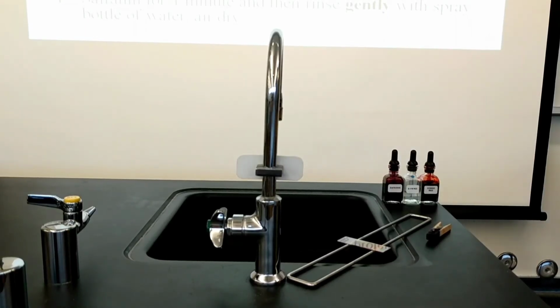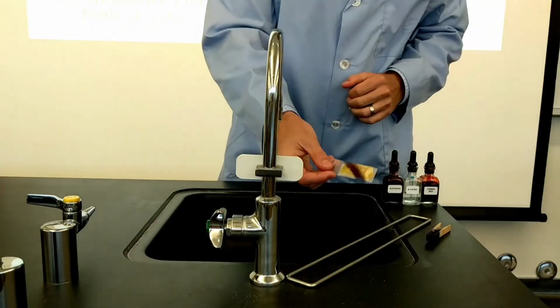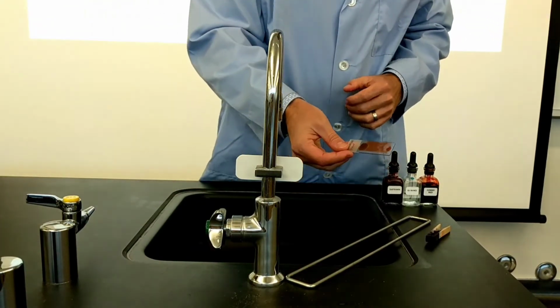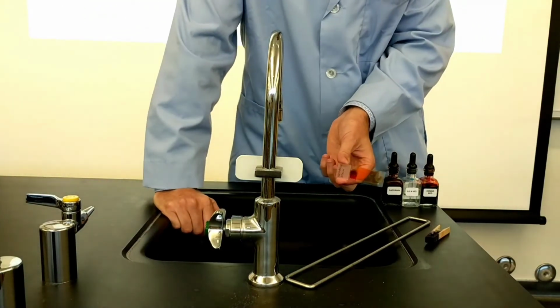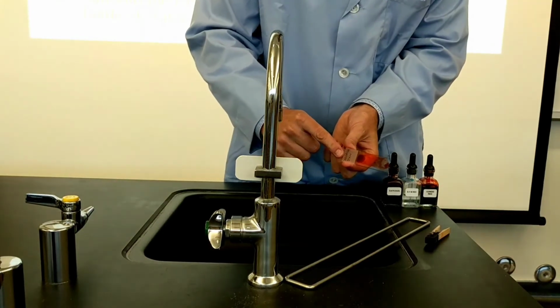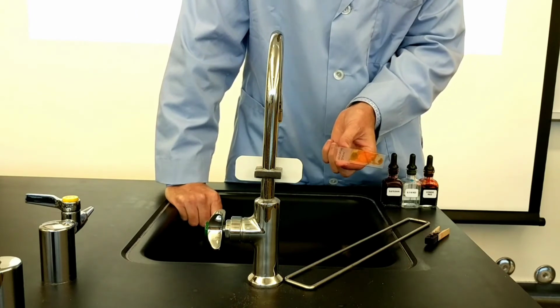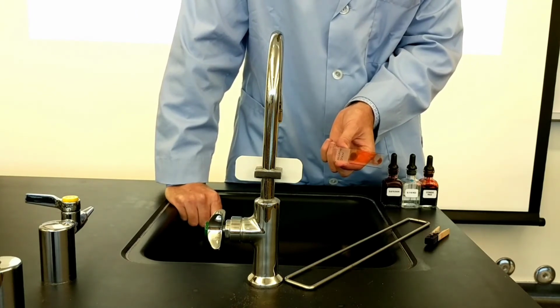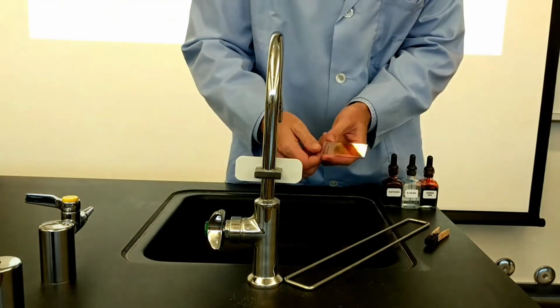All right, as we take a zoomed-in close look, I have my negative stain. Since I'm going to use this for my capsule stain, I can remove this label with some alcohol, or modify it to label it as a capsule stain.